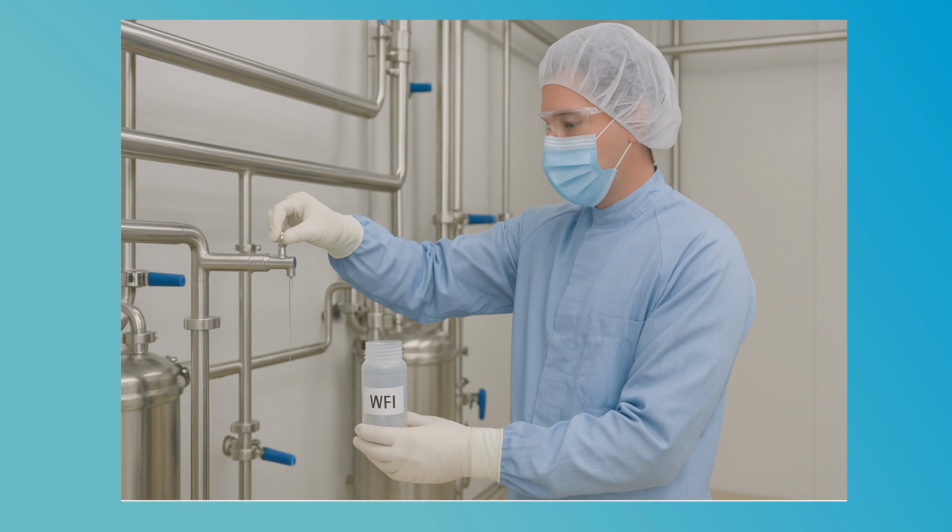Once in the production area, the quality operator will proceed to the designated sampling point. The operator will label the sample immediately with a pre-printed or system-generated label. That label should include the sample ID and sample name and the date the sample was taken.